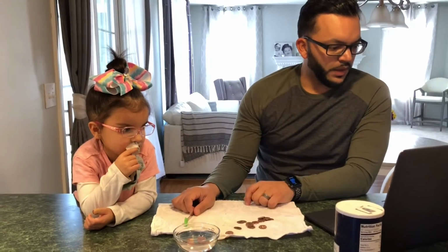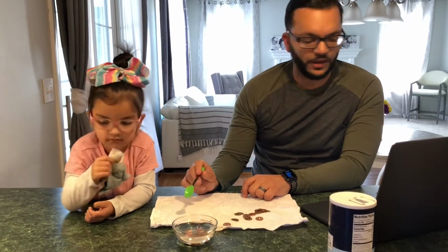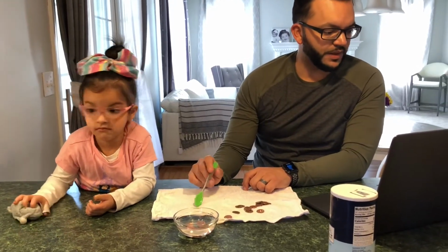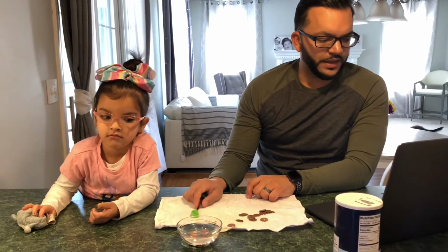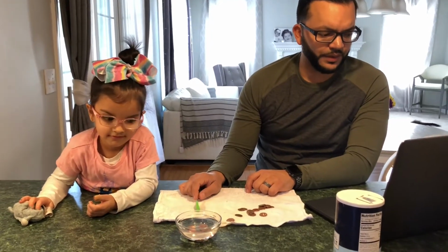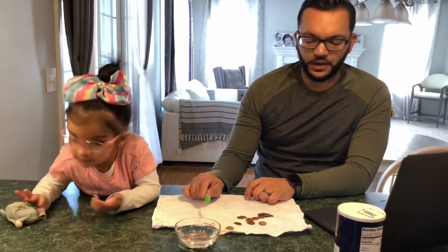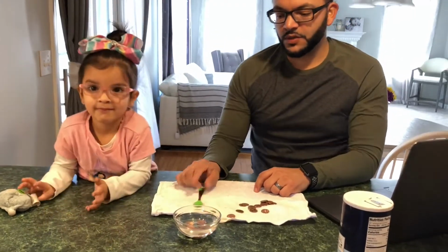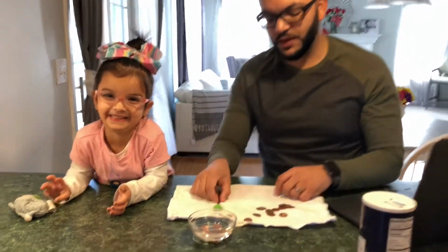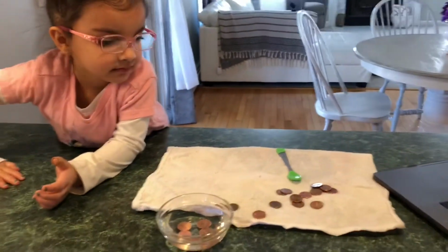Okay, so copper oxide is brownish and sometimes black in color, and depending on other things in the penny's environment, this is why most pennies you see look dirty and tarnished. It's not actually dirt, but the copper oxide that makes them look so dull. And so in this process, we're reversing that, if you will. And so what we're going to do now is we're going to take these pennies out and we're going to put them in some water to stop the process.